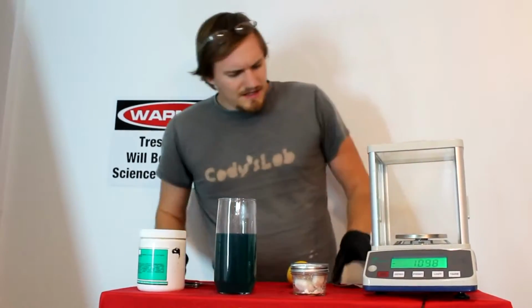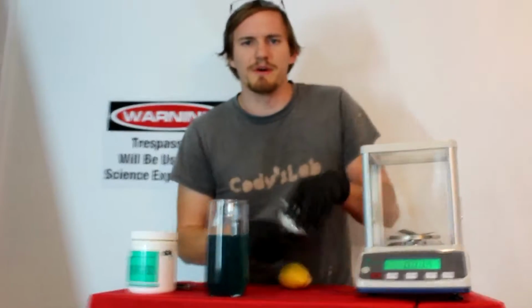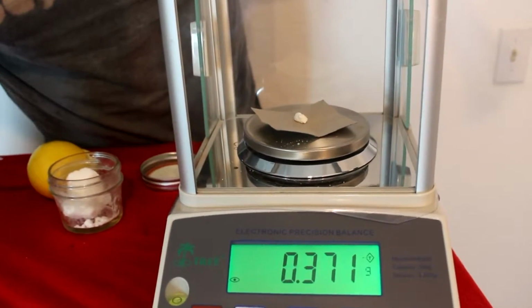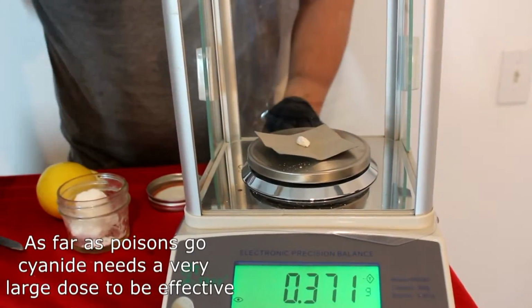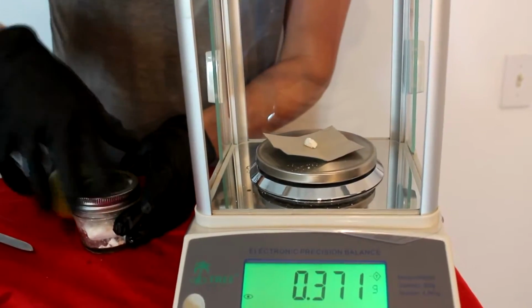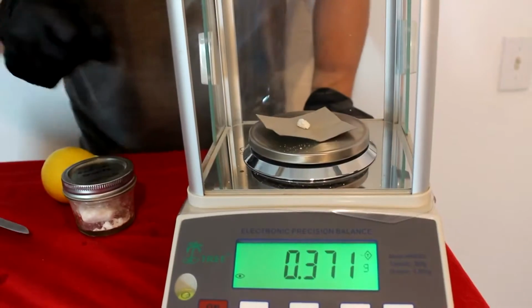In fact, let's come back over to the scale and let's weigh out a potentially lethal dose and see how much larger that is. Alright, 371 milligrams. So if I were to eat that, I'd have a pretty decent chance of dying. Probably right around 60%. I'm fairly strong, so it might even be lower, like 50 or 40.